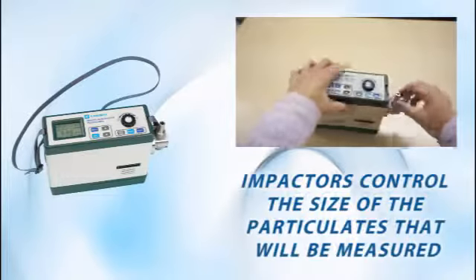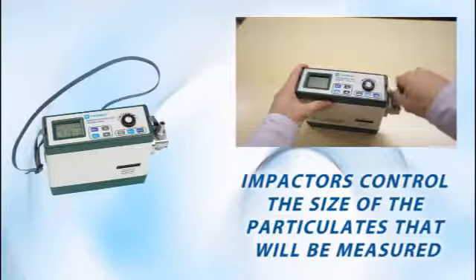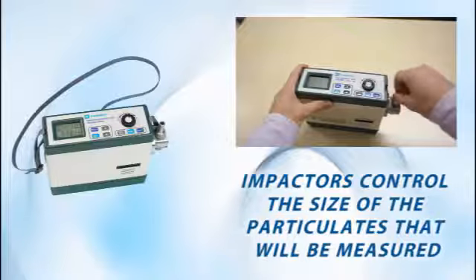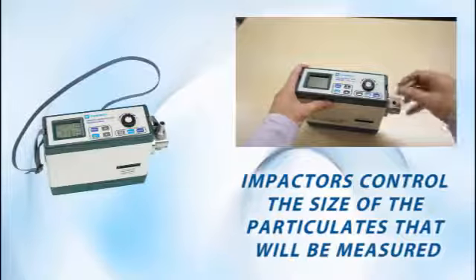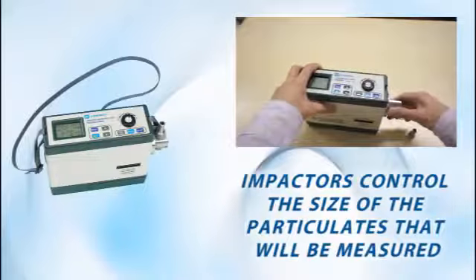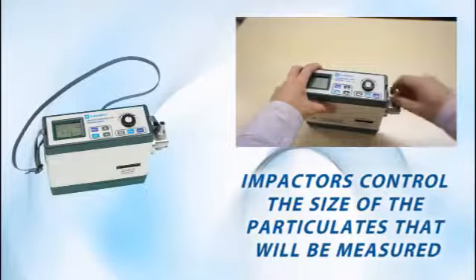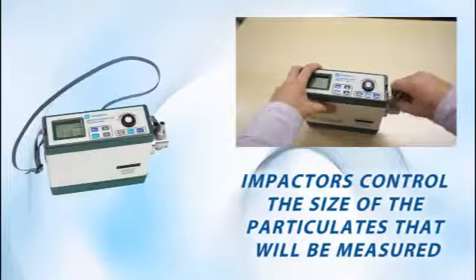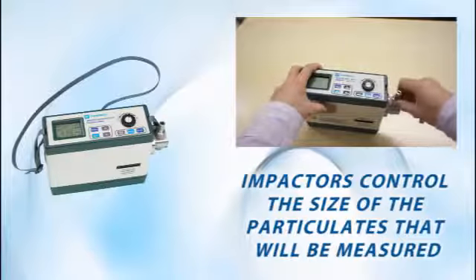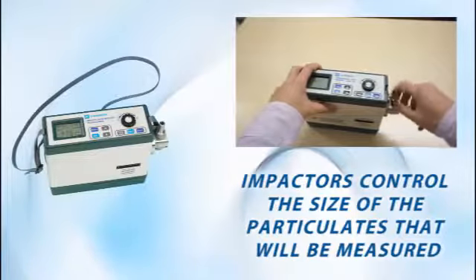Model 3521 comes standard with two impactors: a 10-micron one and a 4-micron one. Model 3522 comes with a single 2.5-micron impactor. These impactors serve as a way to set a cut point for larger particulates — any particle larger than the micron rating of the impactor will not be measured.